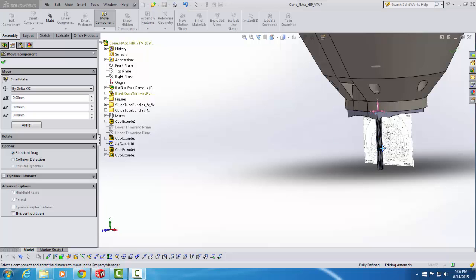So what I need to do first is move this entire bundle back in the posterior direction into the plane that I'm targeting. That's going to be a movement along the Z-axis, and it's going to be a negative sign movement because we're moving posterior to bregma. I said earlier that my target is going to be minus 2.6 millimeters posterior to bregma. So when I click apply, it's going to change the position of this bundle by that amount. I'll hit apply, and there you go.